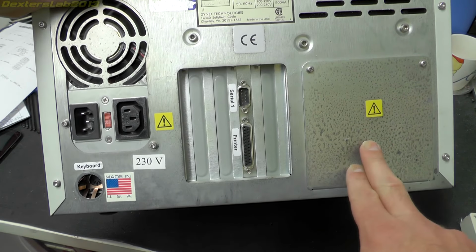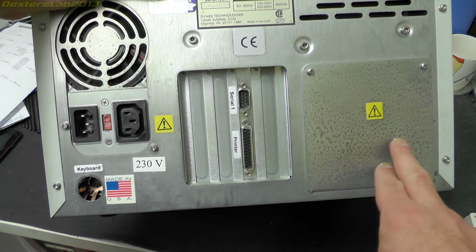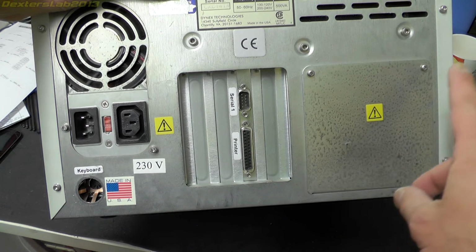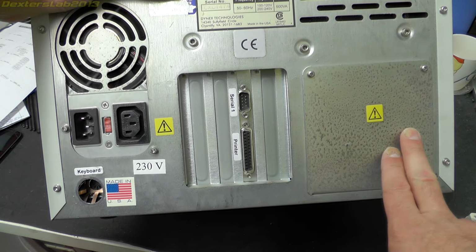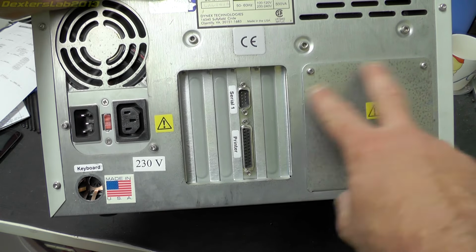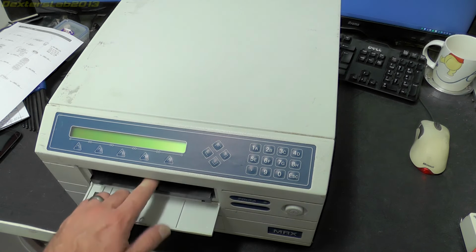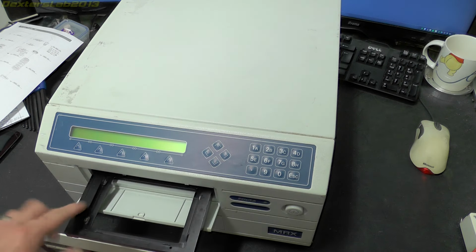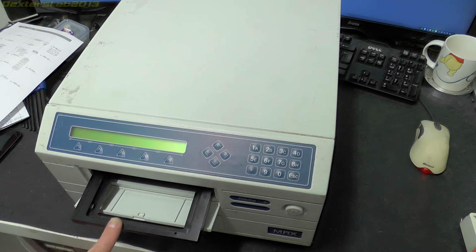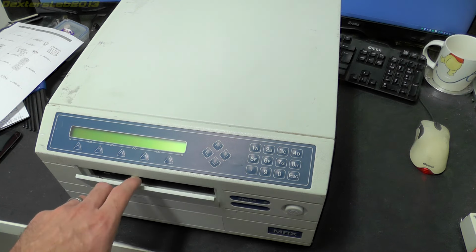It looks like we've got an access door here as well. I have read briefly the instructions, and there's a few user changeable parts in here, notably the light source, and there are a number of colour filter options that can be changed depending on what you actually want to test for. So they are all accessible through this small panel at the back. Now the actual plate that the microplate sits in is actually this unit here. So we've got a nice machined aluminium tray that comes out on quite a nice moving tray, so that just sucks the microplate inside there for analysis.